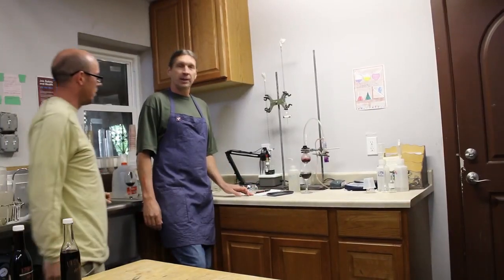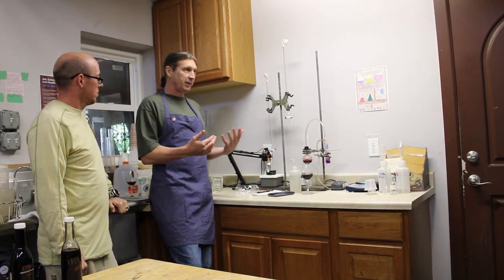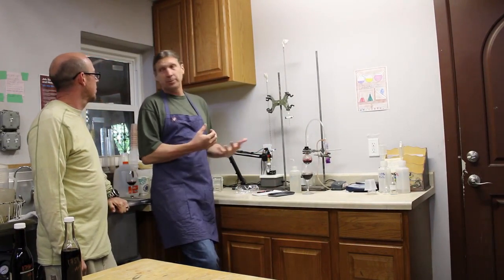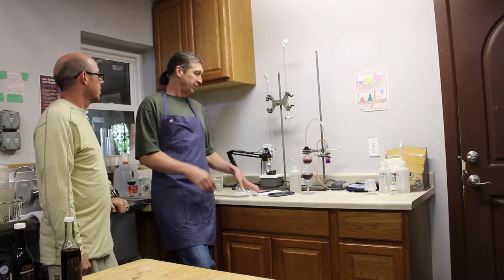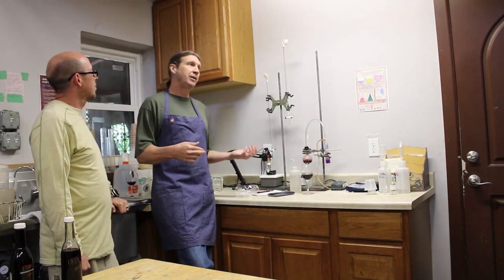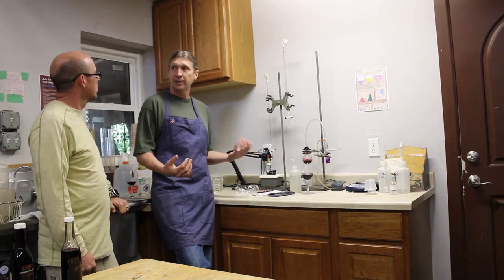So what'd you end up with? So I actually came up with 5.7 grams per liter. Now remember, this is a Syrah, so Syrah you'd expect a little bit lower acidity. 5.7 is actually pretty good for a Syrah. But if this were, say, Cab, Zinfandel, or a Barbera, you'd be probably looking at more 7 to 7.5. Now, grams per liter, if you divide that by 10, you're going to get percent. So this is really going to be 0.57% of acid based on tartaric.